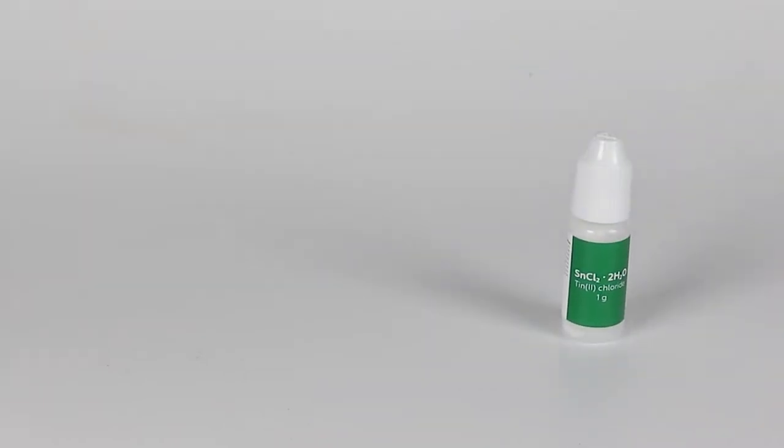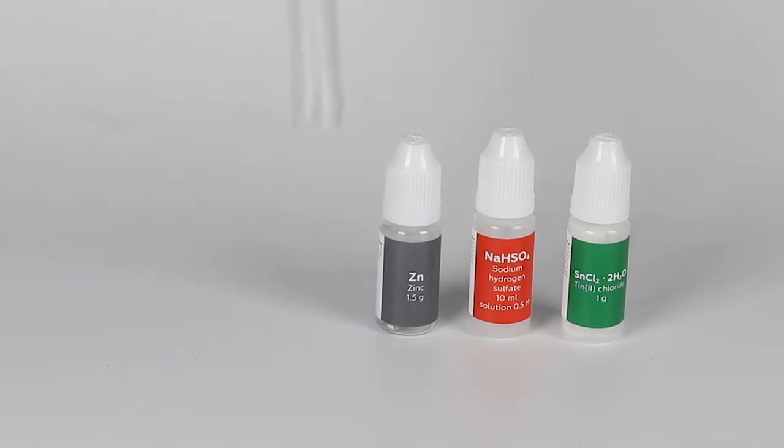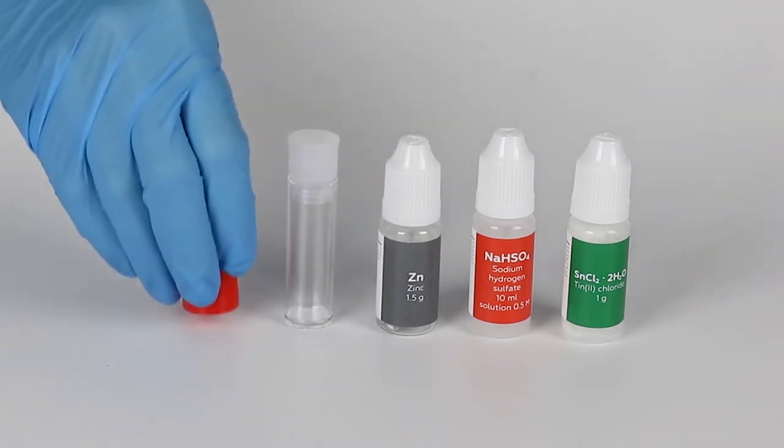you will need Tin Chloride, Sodium Hydrogen Sulfate Solution, Zinc, a vial, a red cap and a tip.